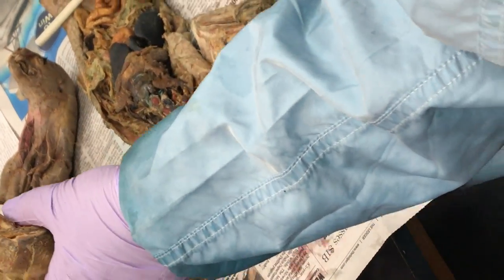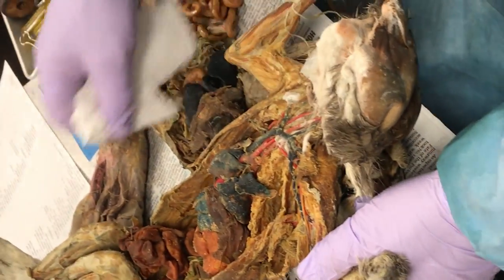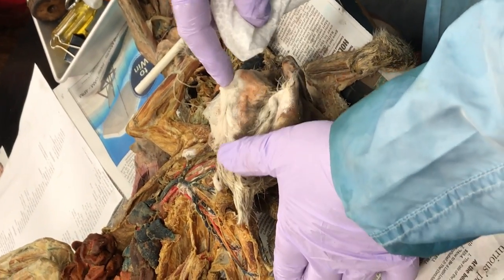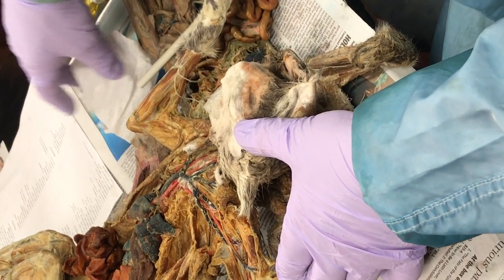This one's not as old — I saved it because it's got excellent arteries. You've got a little tattoo there. Do you see why I saved this? Somebody tell me why I saved this. You can see everything. Man, it's got mold and crud on it, but look at those arteries — holy cats. It's the finest arterial formation ever seen.